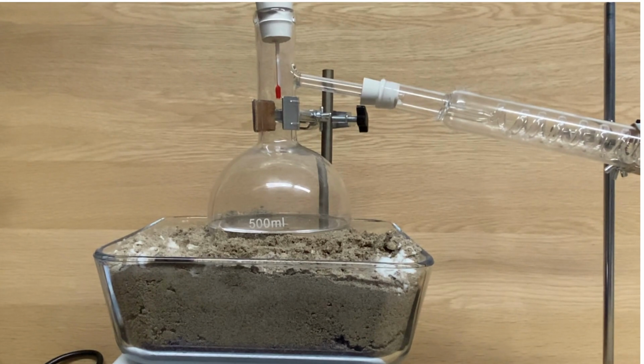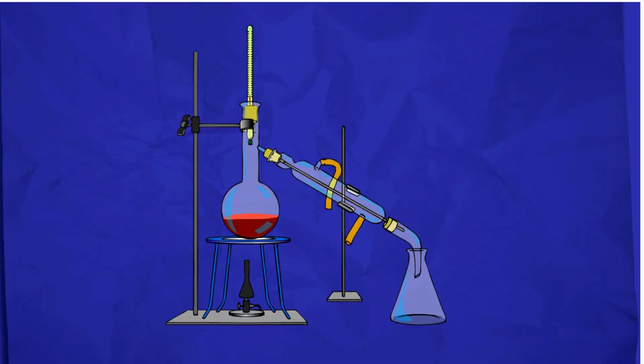Now, distillation is a process that is used, just like filtration, to separate substances from one another. However, with distillation, we will be using different boiling points of molecules rather than solubility. In this video, I will show how it works with alcohol. Also, I will show how you can calculate the percentage of purity of the substance. This way you can measure the success of your experiment.